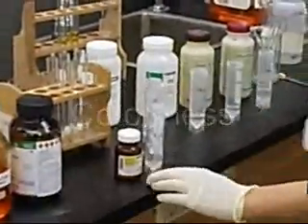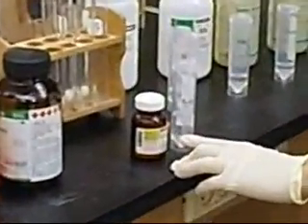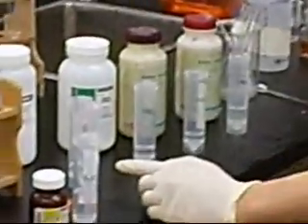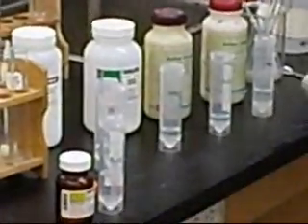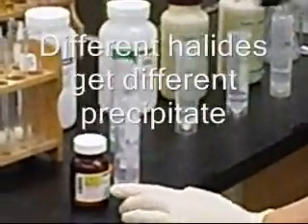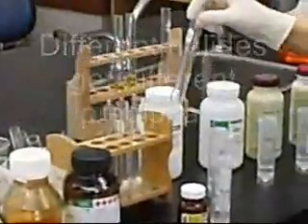There will be a reaction when I add a few drops of silver nitrate to each of the halide salts. Different halide salts react with silver nitrate to produce different precipitates.